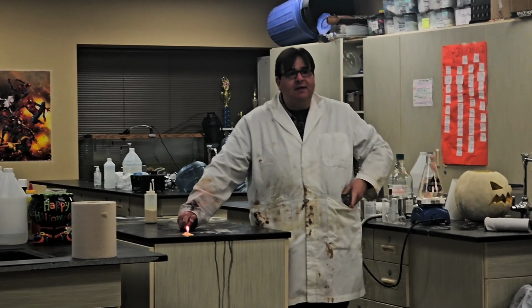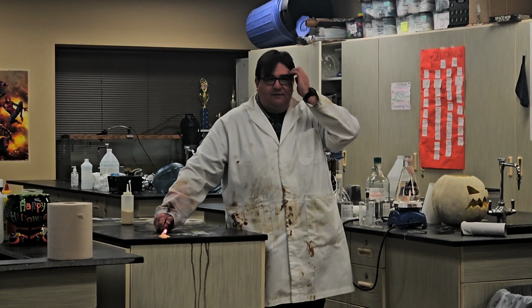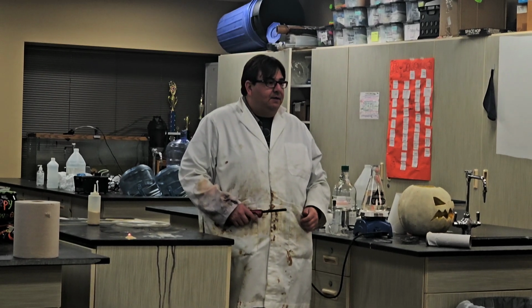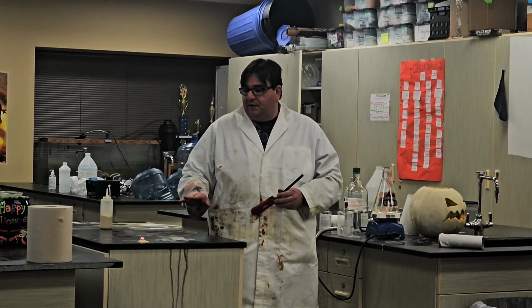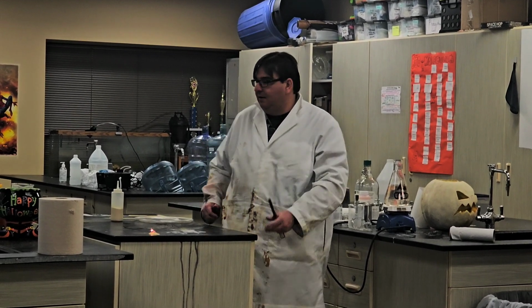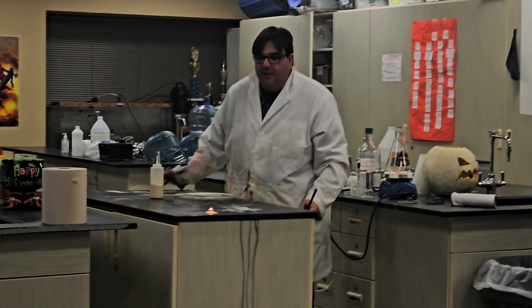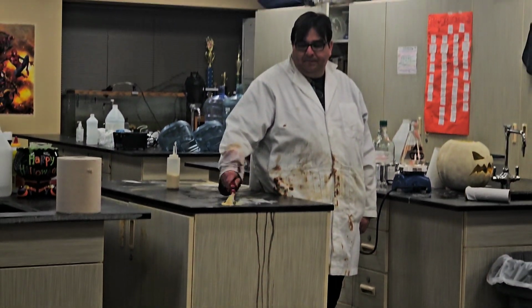So, this is an important lesson of, again, just because you have lots of amounts of stuff doesn't mean you're going to get anything cool. So I have a large pile of the very flammable stuff, but it's all about air to fuel ratio. So there's too much fuel to air currently inside of this pile right here. So I can change that, see if I can get it to work, by doing this.